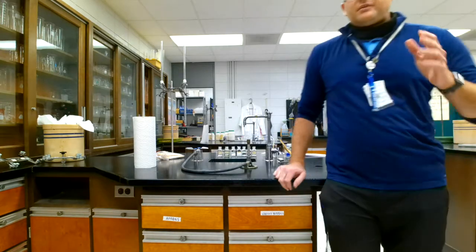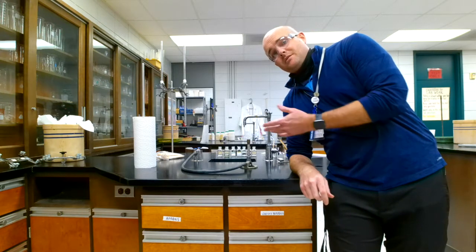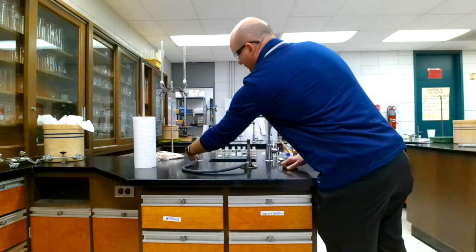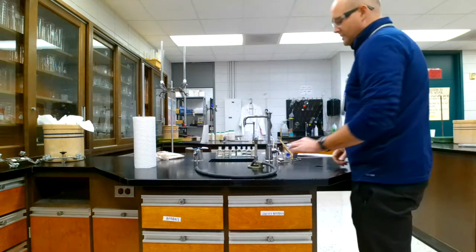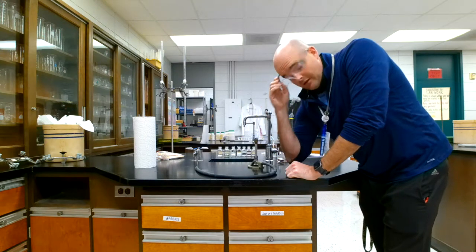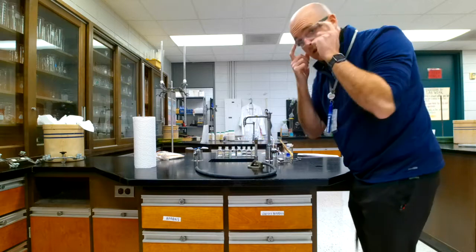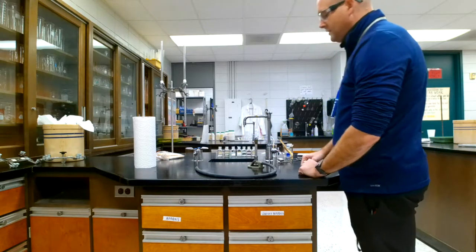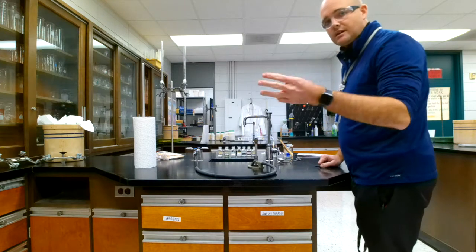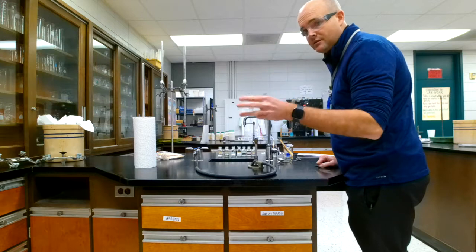Okay, we're here to do our flame test lab, and what we're going to do is you have to use a Bunsen burner. So the first thing is to show you how to use one. First thing is you need to secure it yourself. So I will roll up my sleeves, and I will make sure I'm wearing my proper eye protection. Second thing is secure your area, and third thing is to secure your equipment. Secure yourself, secure your area, secure your equipment.